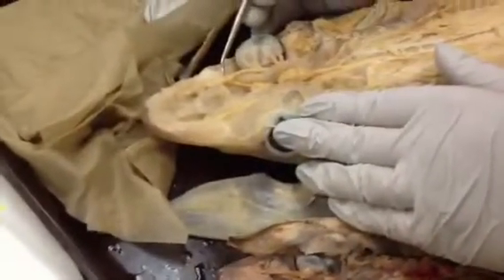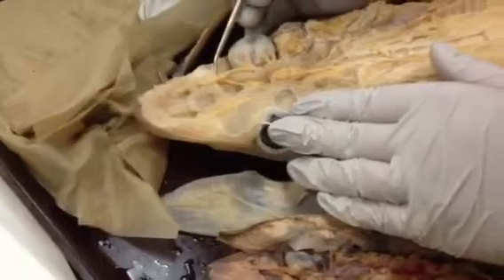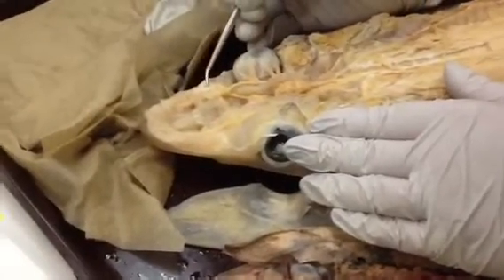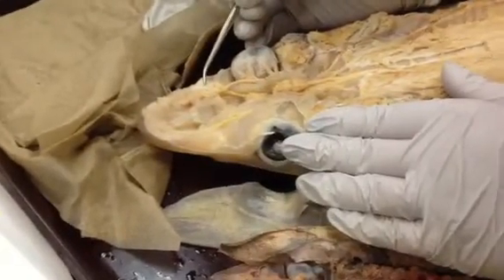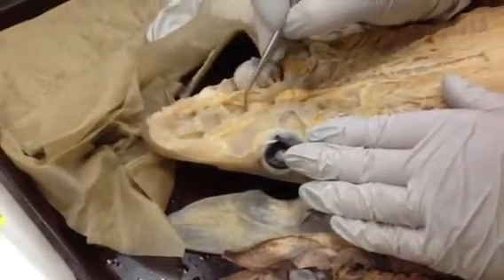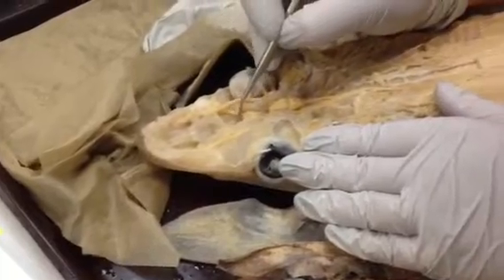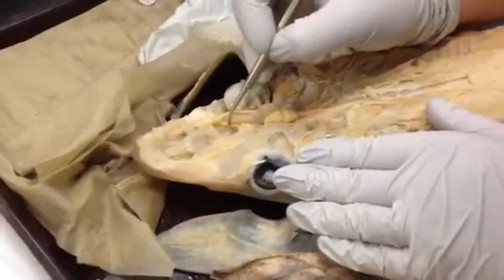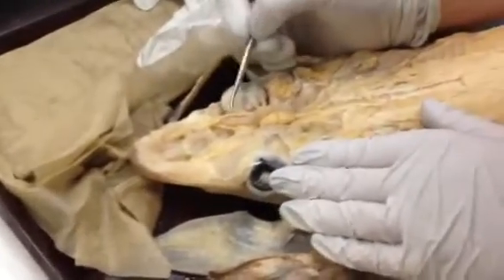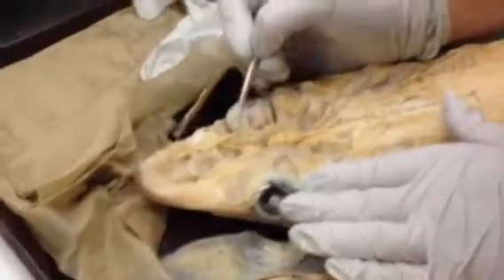It's here. Olfactory sac — here. Olfactory sac — here. Olfactory lobe. Olfactory lobe, here.